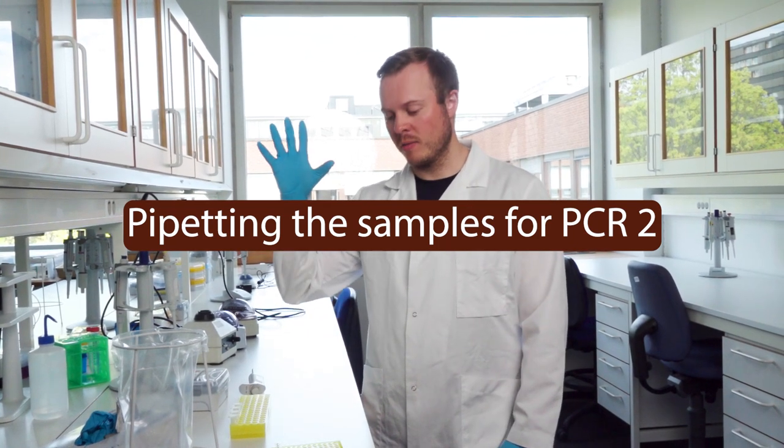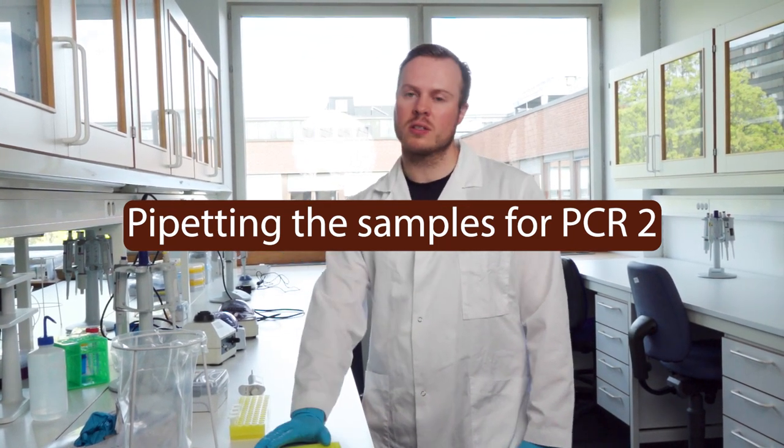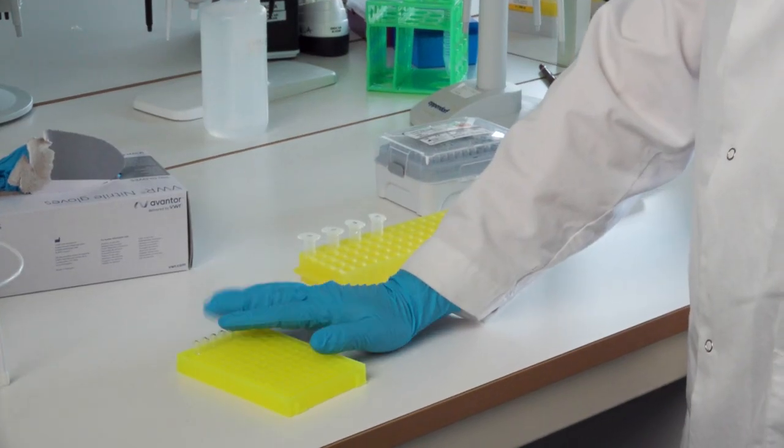Okay, so now we have pipetted the master mix into the PCR tubes, and we have also added the index primers to the correct tube.